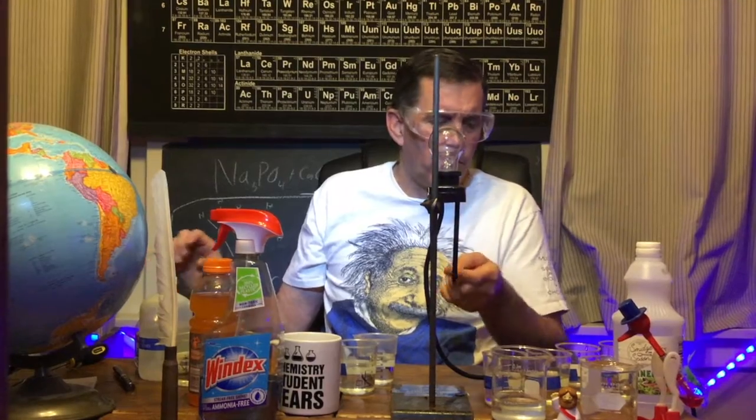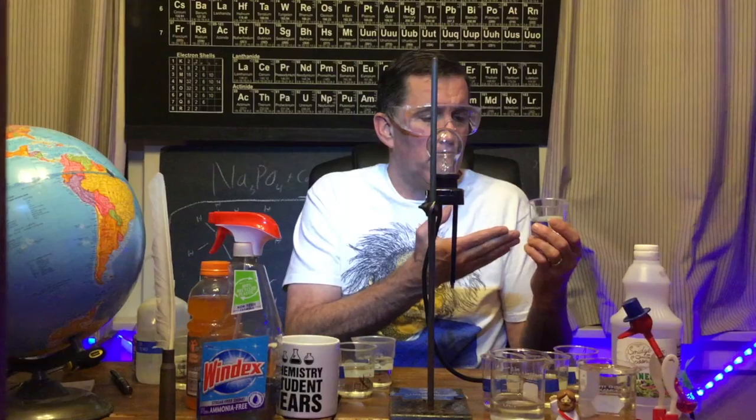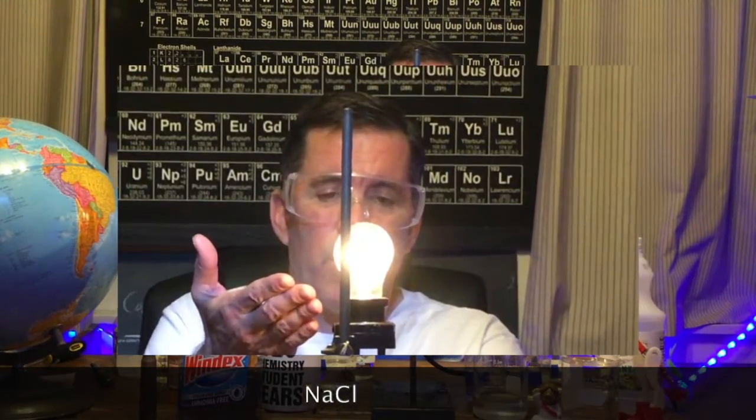But is there something else we could use to conduct electricity to complete this circuit? You've learned that there are other kinds of charged particles, like electrons — ions. You've spent a lot of time memorizing those ions. So here's one: sodium chloride. I dissolve sodium chloride in water, and if it dissolves as ions, those ions could be free to move. Let's see — look, it's very bright! It's a very strong conductor, so this solution of sodium chloride conducts electricity.